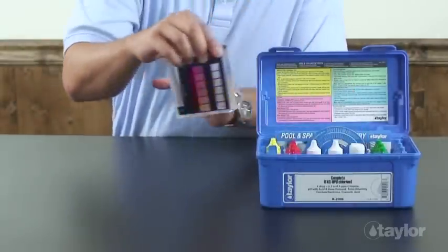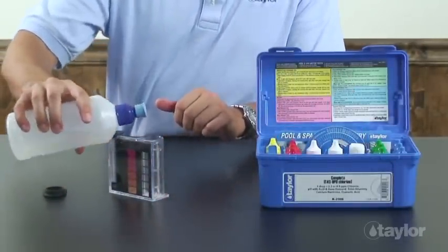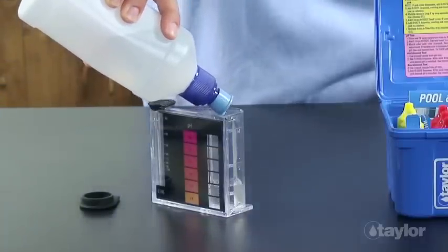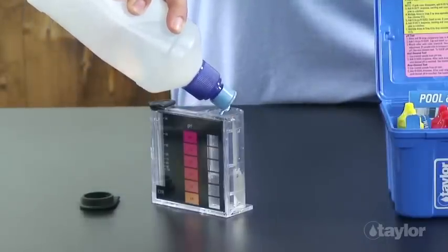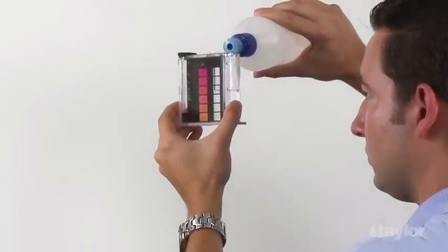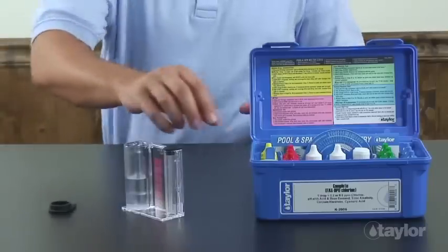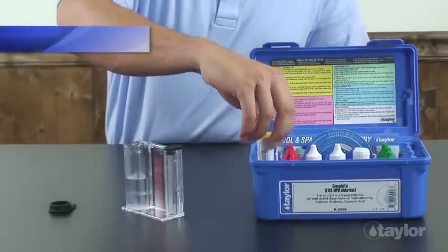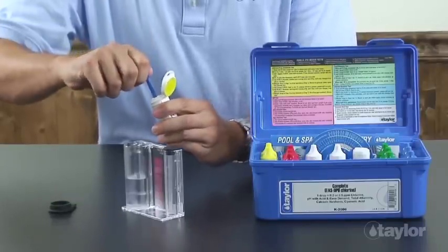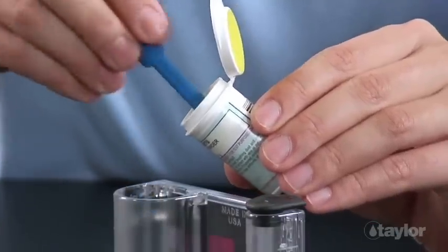Rinse and fill the large comparator tube to the 25 ml mark with the water to be tested. Add two dippers of DPD powder. The scoop end of the dipper should be completely filled with the powder, but beyond this, a precise measurement is not necessary.